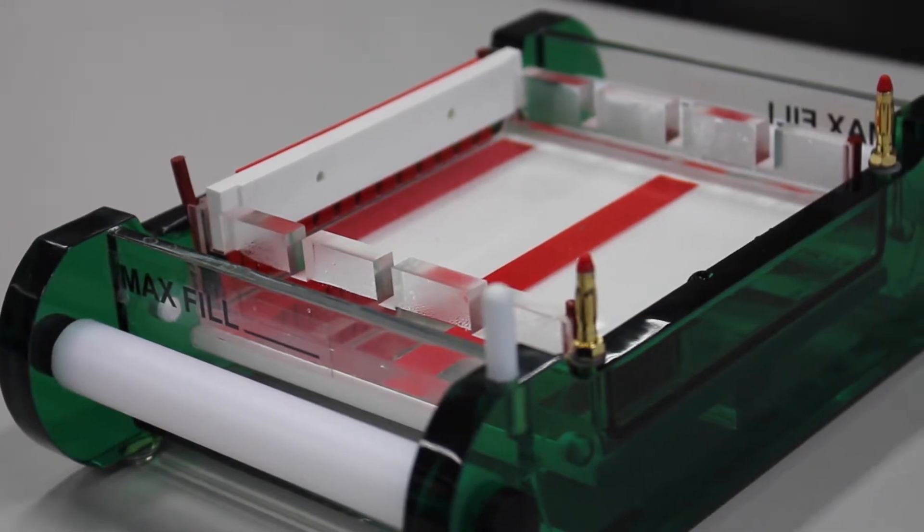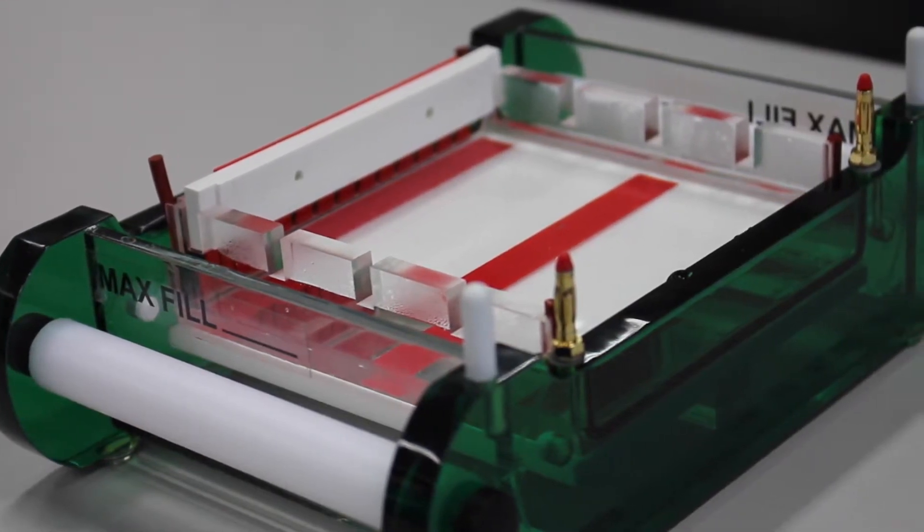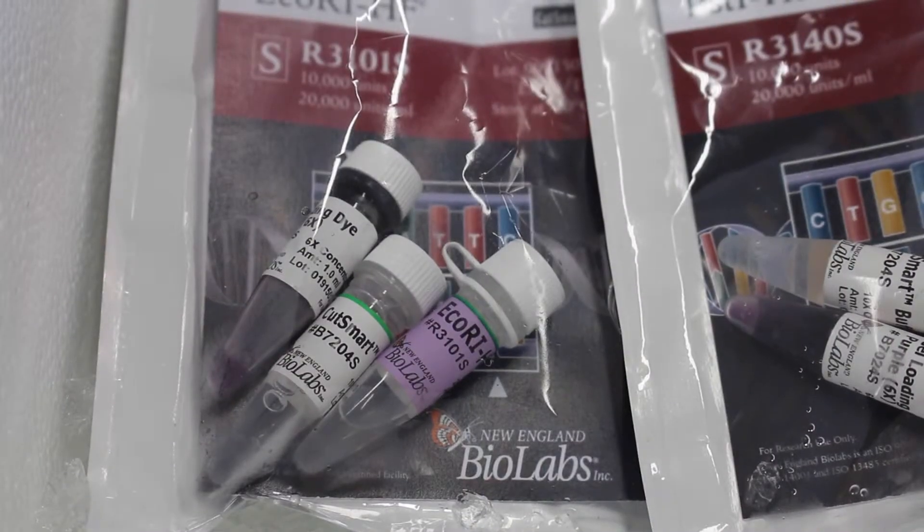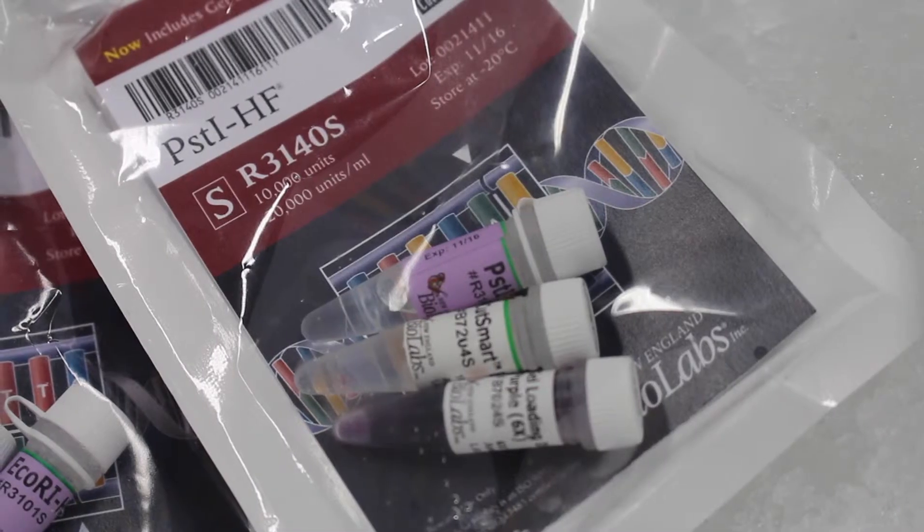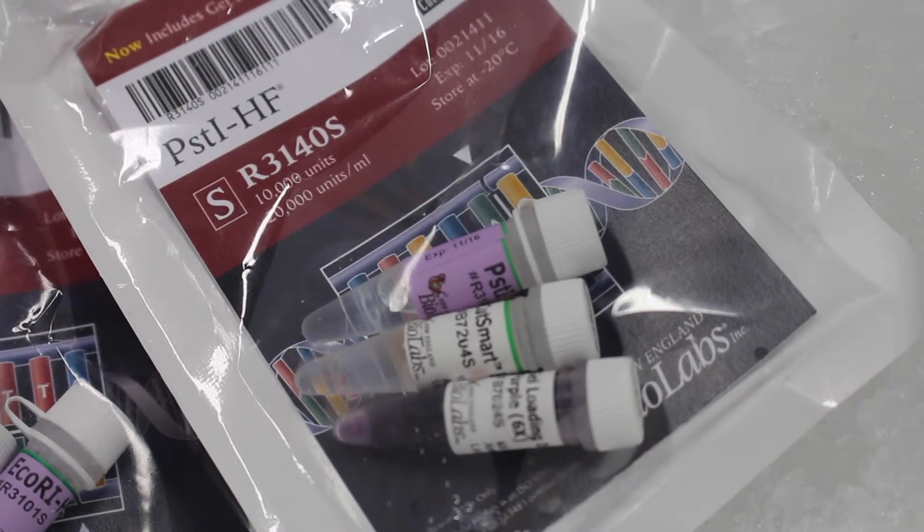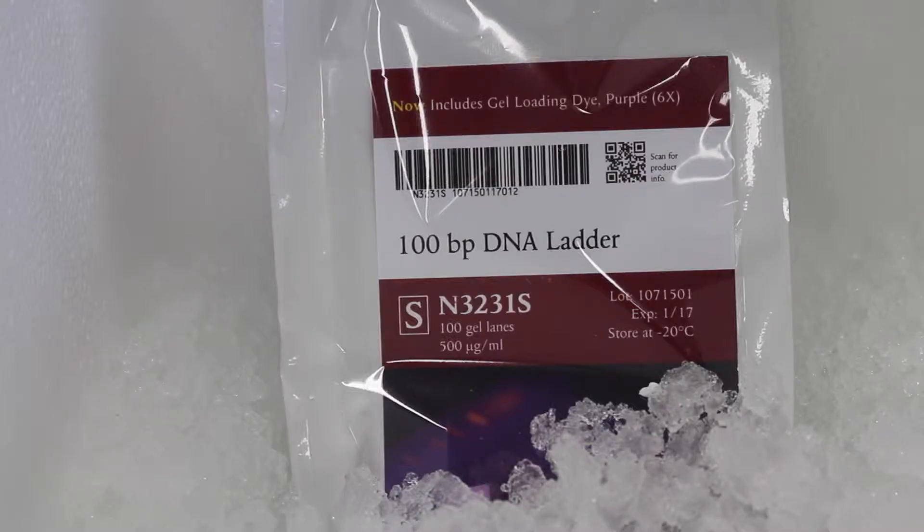While the gel is left to solidify, the samples are prepared. To prepare the samples, the following are needed: DNA, reaction buffer for restriction enzymes, the enzymes ECO-R1 and PST-1, gel loading dye, and DNA ladder.